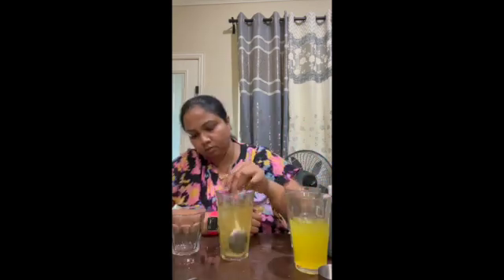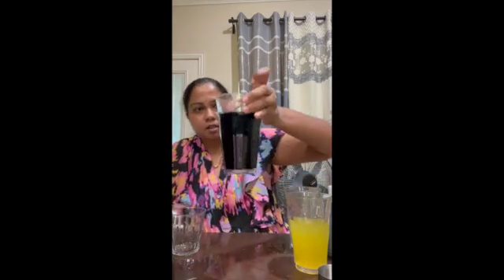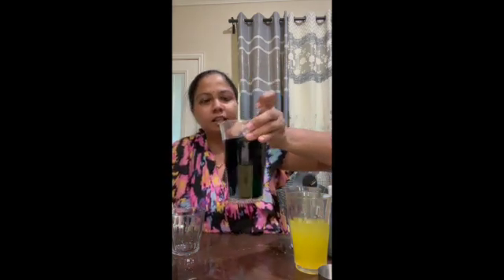I think it is taking a little longer than expected. Let me go ahead and stir. After doing this, I could see the color change, as you can see. Oh my goodness, it's a success. I can see a bluish, blackish kind of liquid. It is because of triiodide reacting with the starch solution.